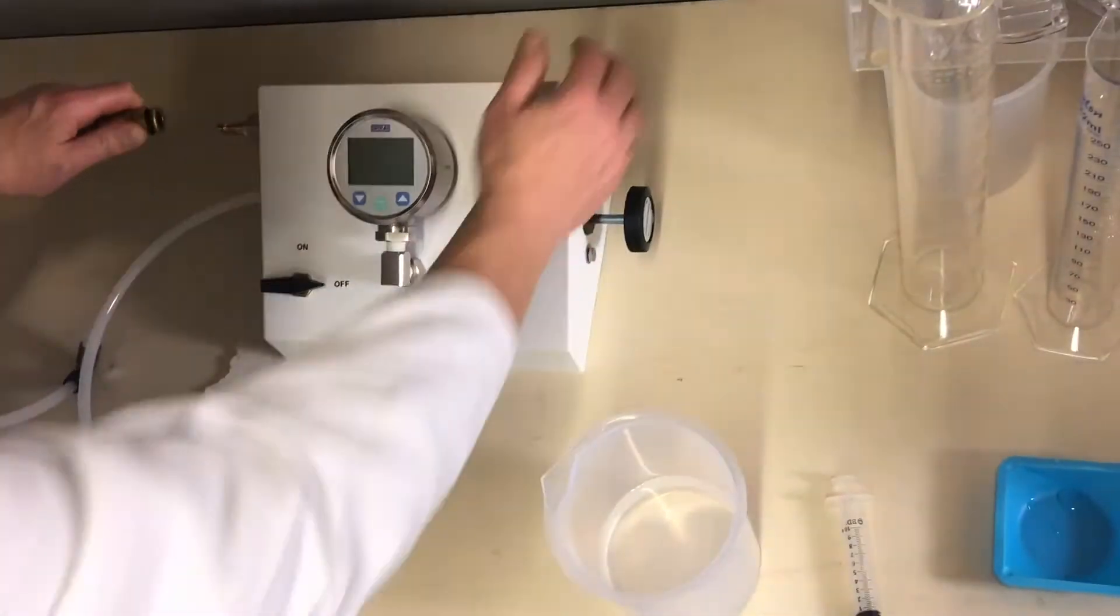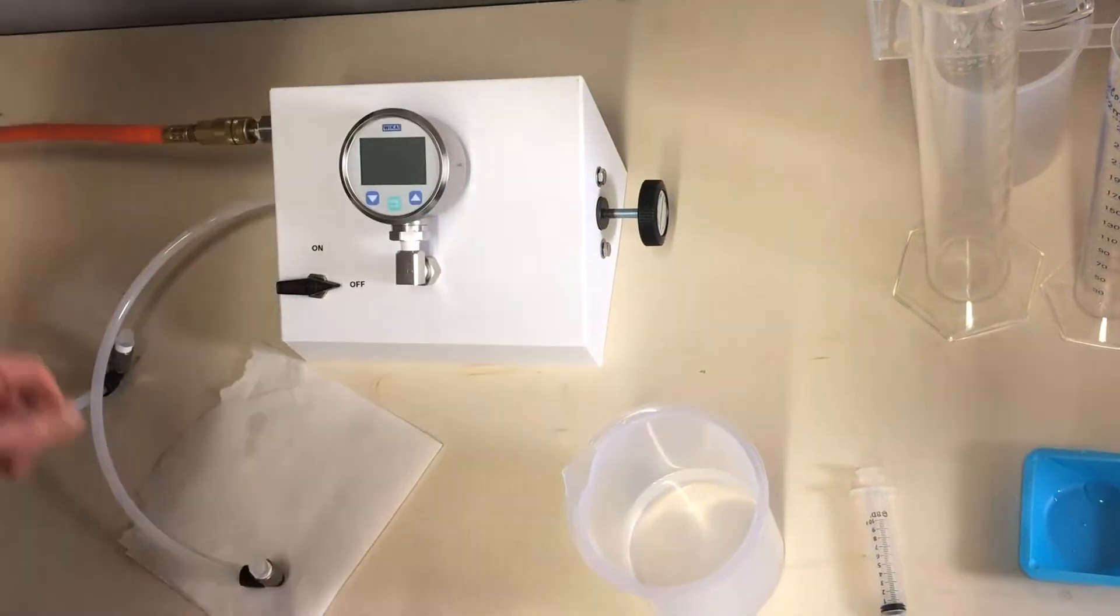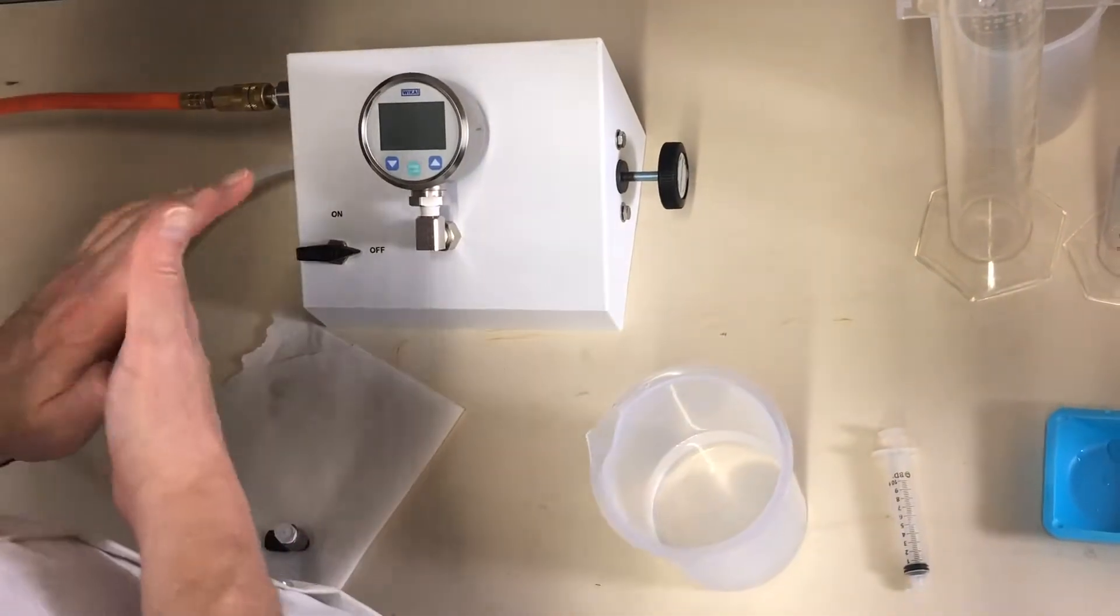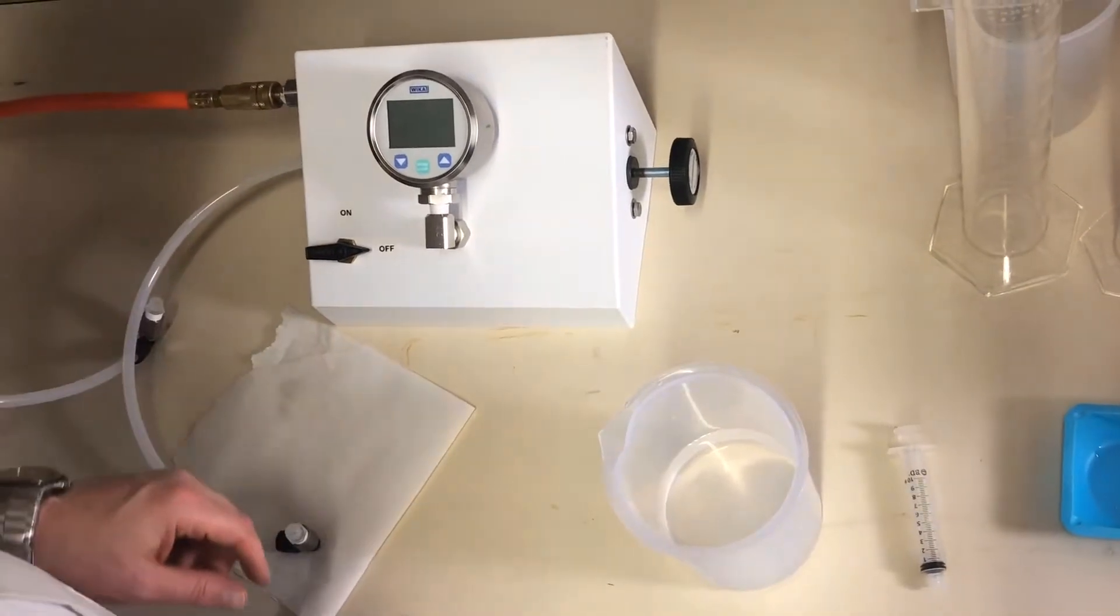Alright, pull back on the collar, hold the housing, and then push in firmly. There we go. Easy. It's not that easy. I think our coupler is a little bit worn.